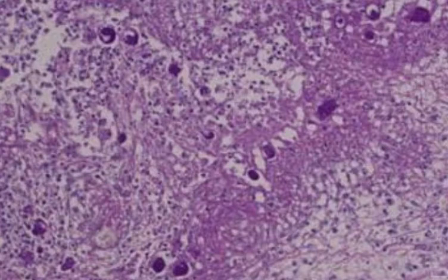This is a slide of the parasitic protozoan Entamoeba histolytica. It is a microscopic endoparasite of the colon of human beings, causing intestinal amoebiasis. The trophozoite is the most active, motile and feeding stage, which causes amoebiasis in human beings.